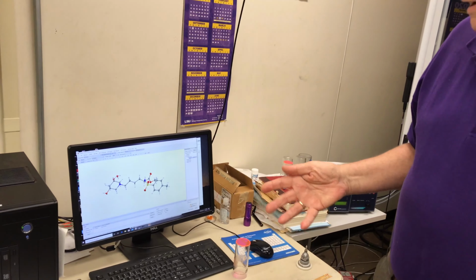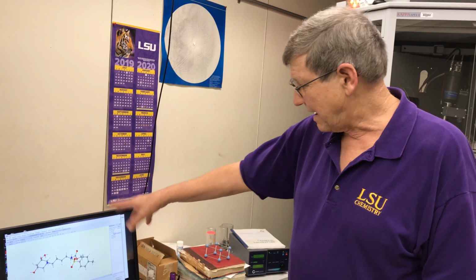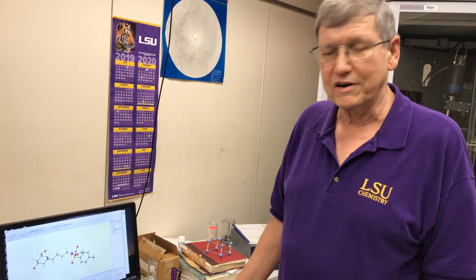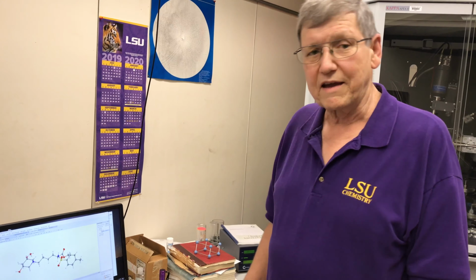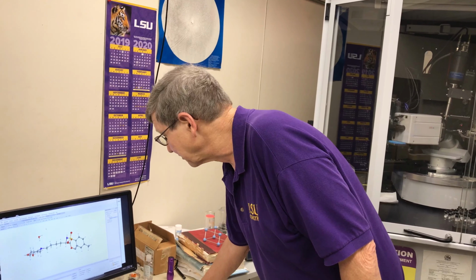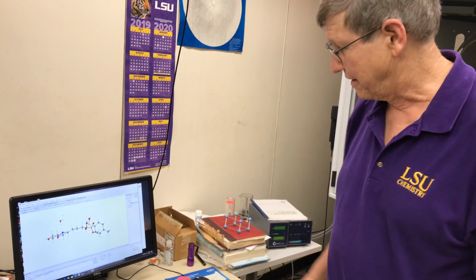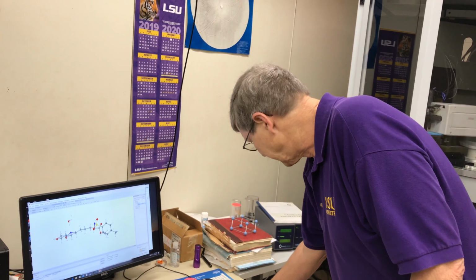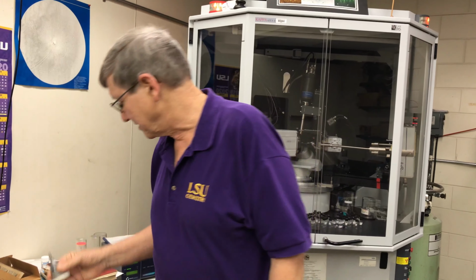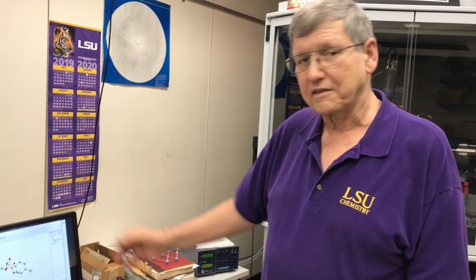To begin with, we identify what the compound is, which is what a lot of people want to know. But besides that, we get all the bond distances and angles. We can identify the atoms, tell what kind of bonds we have, single bonds, double bonds, and so on. We can look at intermolecular contacts. For instance, this is a water molecule with hydrogen bonded to nitrogen there. So from this really extremely tiny sample here, in a matter of sometimes just hours or maybe a day or two, we can get this tremendous amount of structural information about that particular compound.